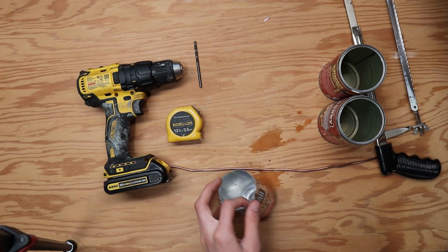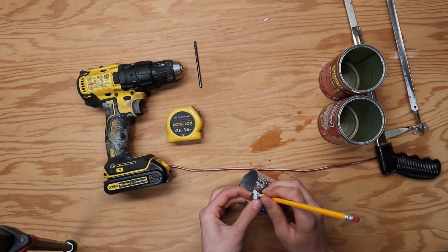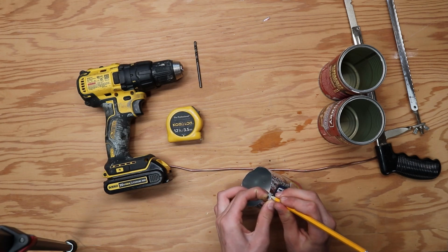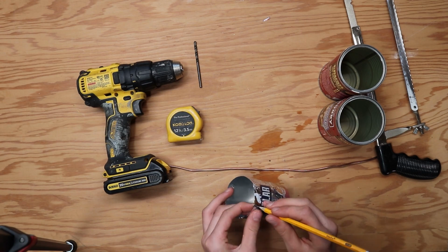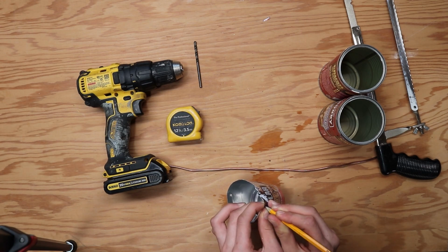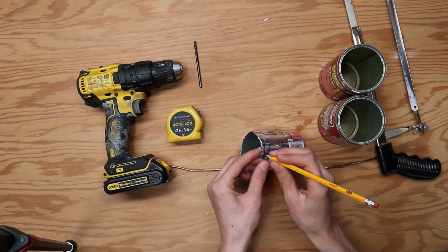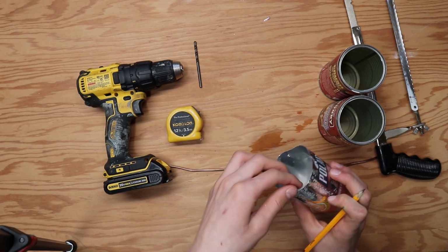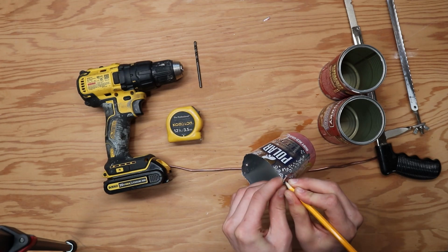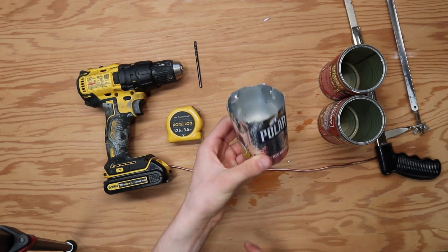At this point, you can either use a pencil or a drill to poke holes opposite each other in the can. Poke 2 holes opposite each other in the top of the can, and then 2 holes perpendicular to those that are also opposite each other. What these are going to be used for is sticking your wire through them in an X pattern so that they are suspended inside of the other cans. Go ahead and set that can aside, and now we're going to work with the larger cans.